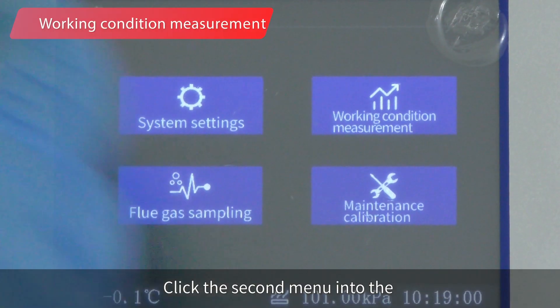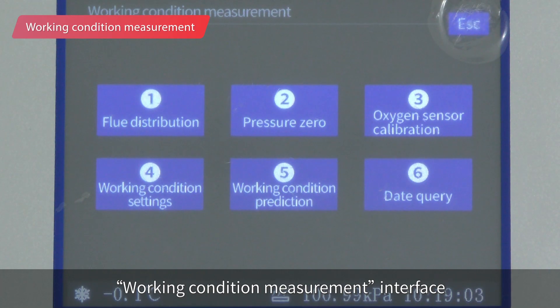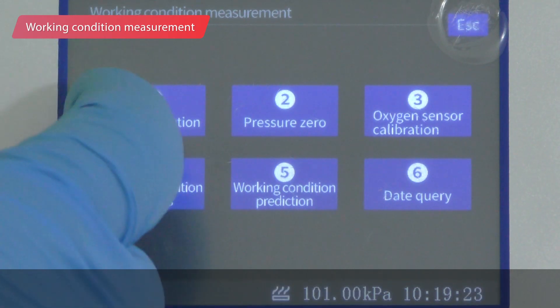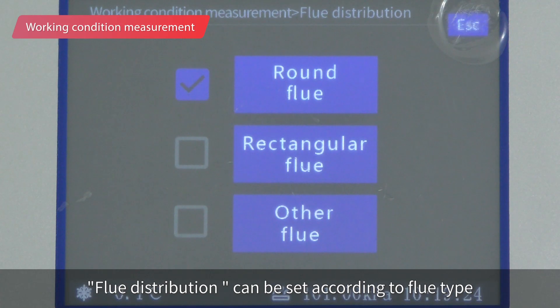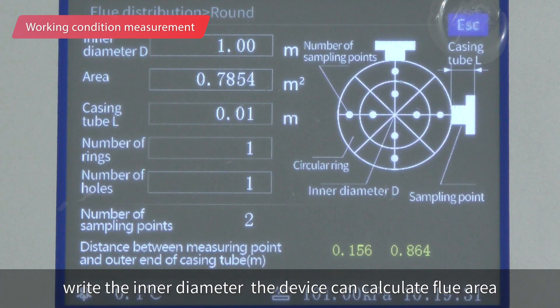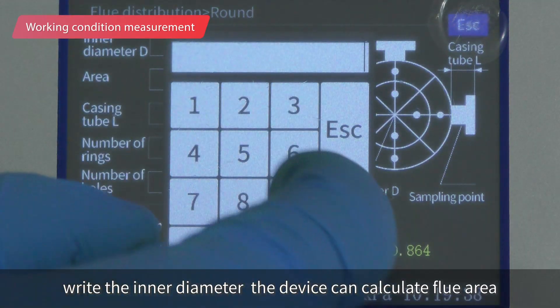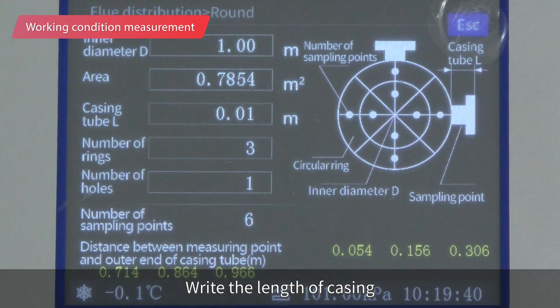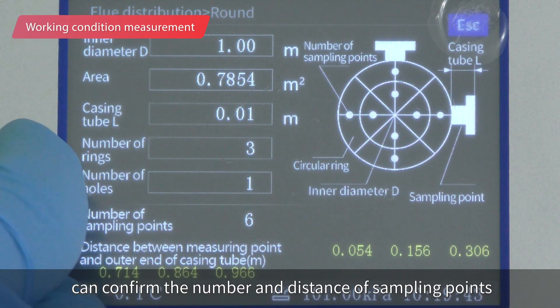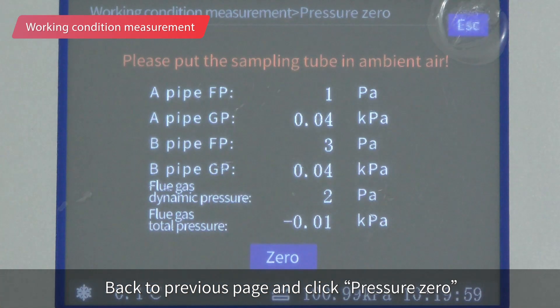Click the second menu to enter the working condition measurement interface, where you can see six menus. Enter flue distribution — this can be set according to flue type. For a round flue, write the inner diameter and the device will calculate the flue area. Write the length of the casing to confirm the number and distance of sampling points. Then go back to the previous page and click Pressure Zero.